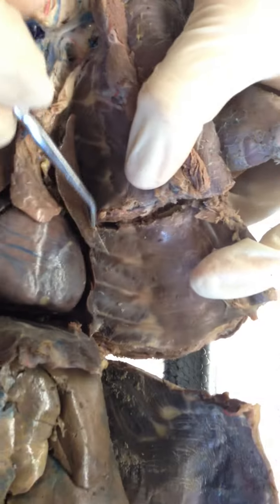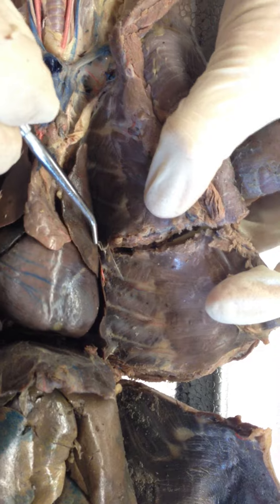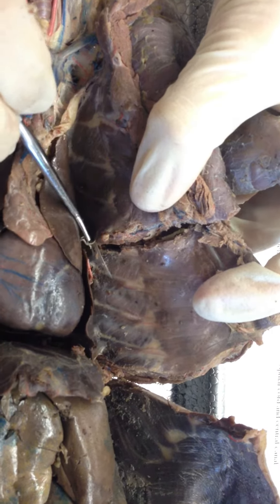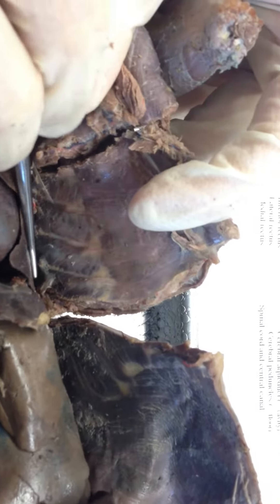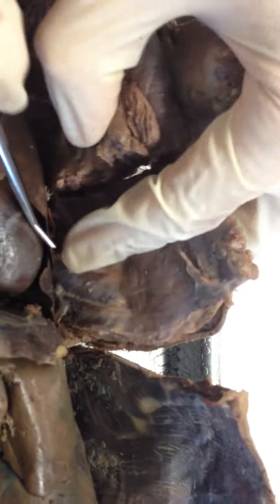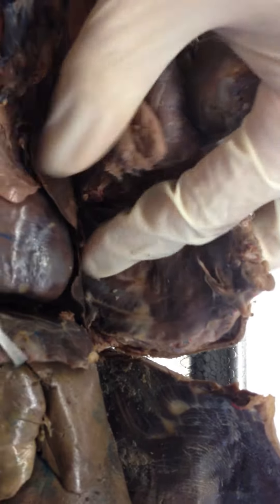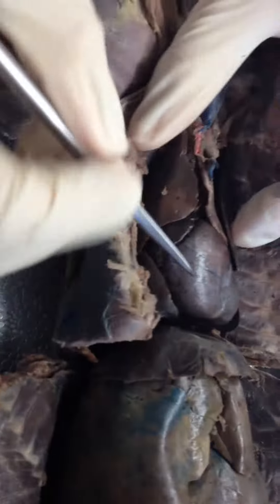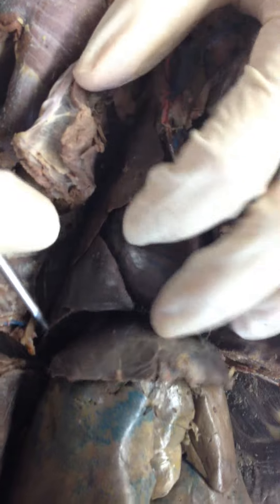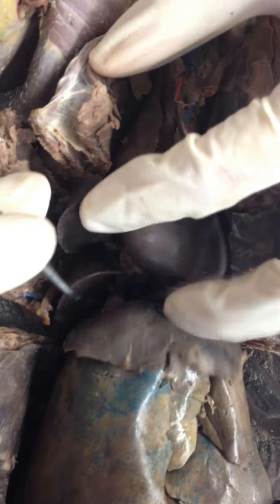On this side, this is your left lung — you have your cranial and your caudal lobe. These two should be smashed together because they're just kind of wet and now they're dried out. This is your right lobe — you have your cranial, middle, and caudal accessory.